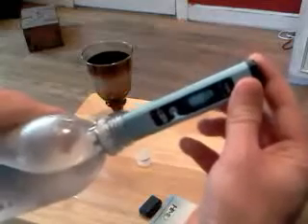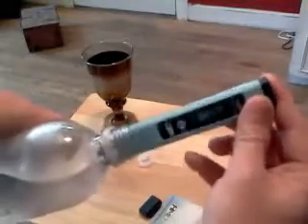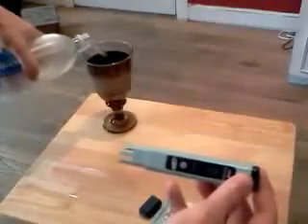It's going to be a little difficult here — probably going to have to pour some out in this glass. This glass may put a few impurities in the water, so it's not going to be too accurate. But I'm getting a reading of 18, 16, 19 — somewhere in there, 18 or 19.